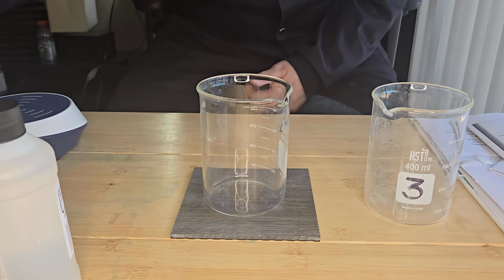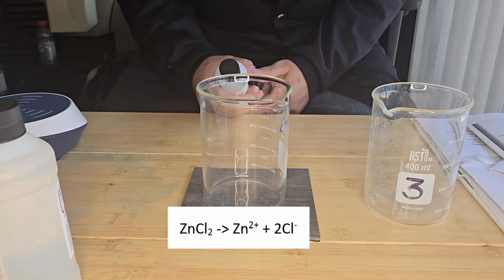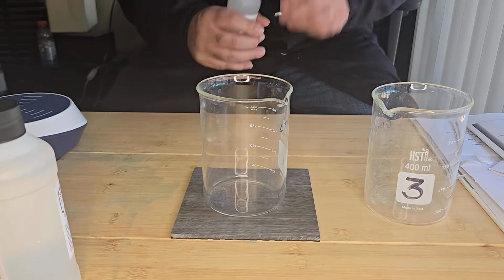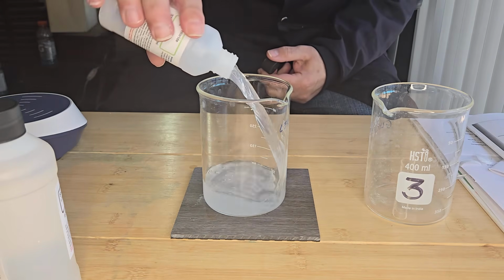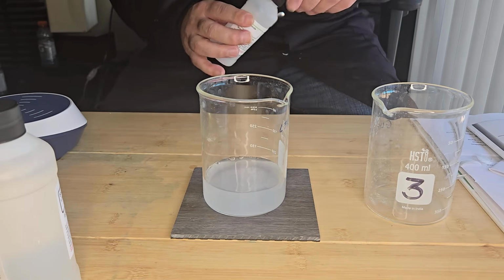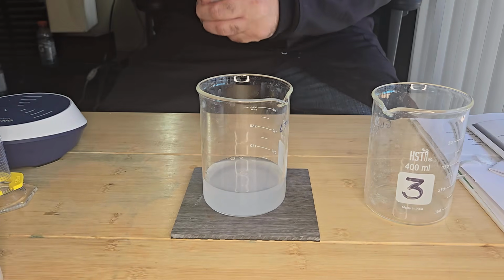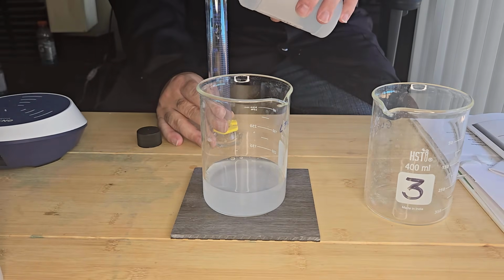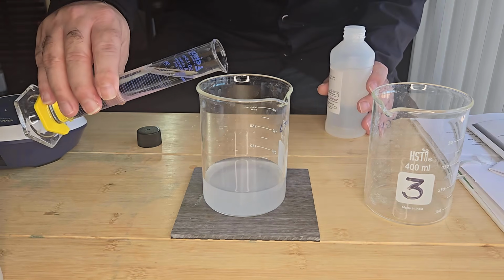Okay, so we're going to start off with our zinc chloride in water solution. Zinc chloride dissociates completely. The zinc ion is a Lewis acid and exists as a hydrated complex in water. So I'm going to add about 100 mL of zinc chloride. And then I'm going to add about 50 mL of our 1 molar sodium hydroxide solution. And we're going to see what happens.